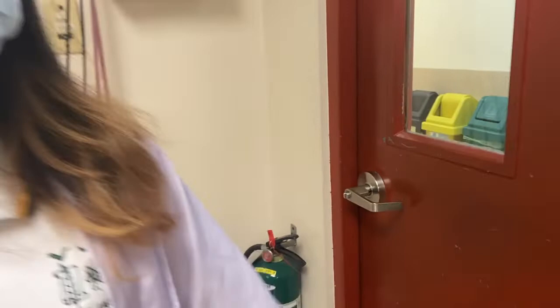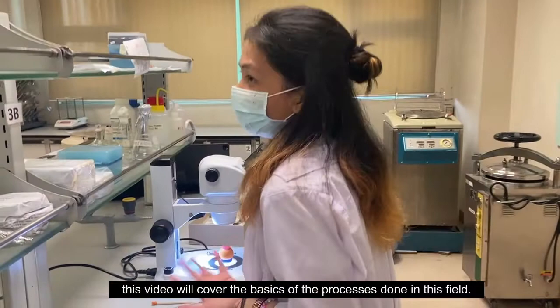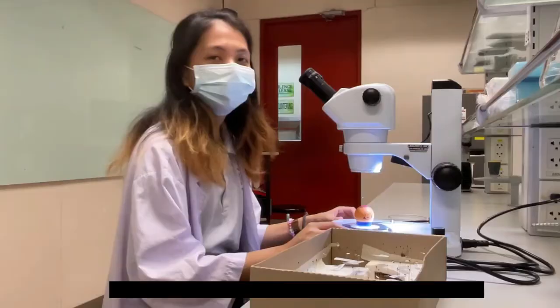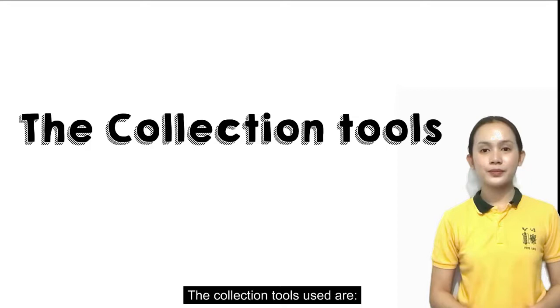To briefly introduce the field of medical entomology, this video will cover the basic processes done in this field. It is through the steps that the field of medical entomology relies upon that the proper execution should be observed. Come with me as we discuss these matters.